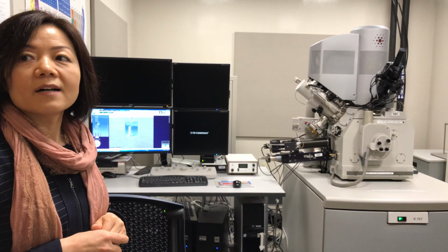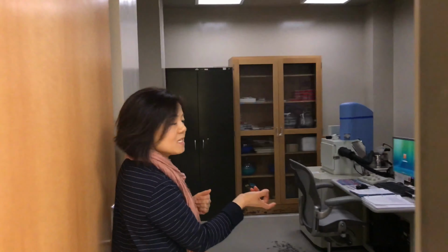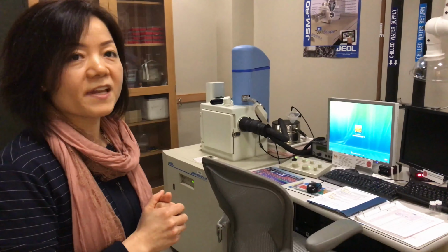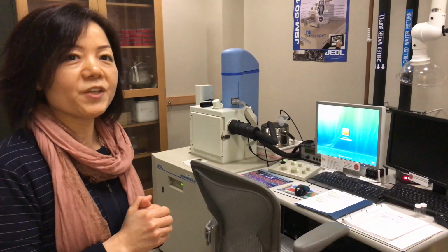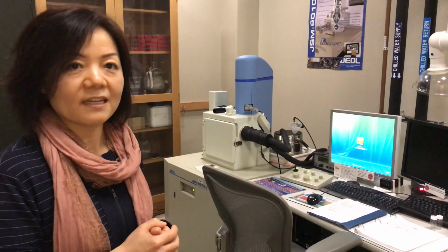So we can do the chemical analysis or structural analysis, like what type of crystal they are and orientation, those detailed information. We have another SEM. If you look closer, this is from JEOL. It's a tungsten filament. Big difference between this SEM and the other one I showed is the electron source, and this one is from tungsten filament. The other one is a field emission. So field emission always provides better resolution, and this one, the resolution is still okay. So we use it for mostly soft material, like tissue cells after you fix it and prepare it in a certain way. So it's for SEM ready.